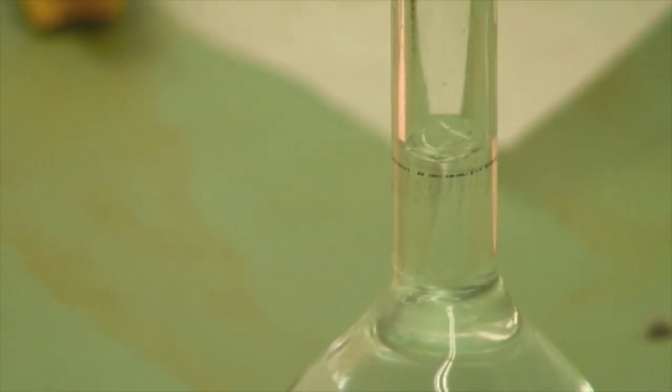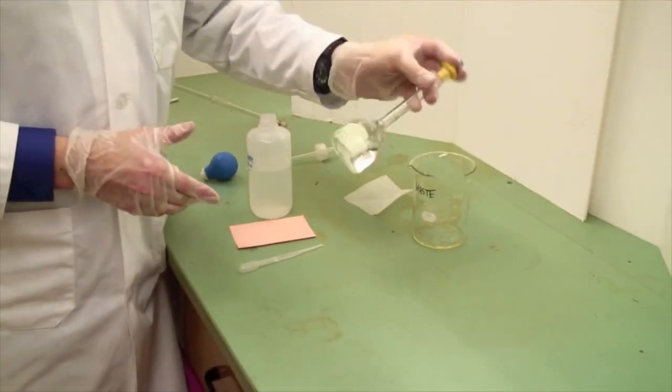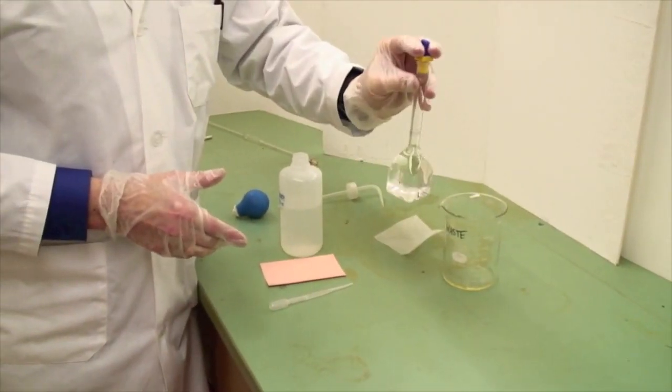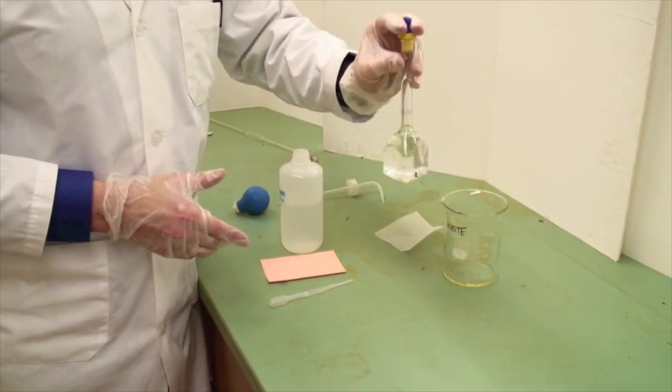We've now got exactly 100 mils in here. Again, put the cap on and invert a few times to let the bubble do the stirring so that we've got a uniform solution.